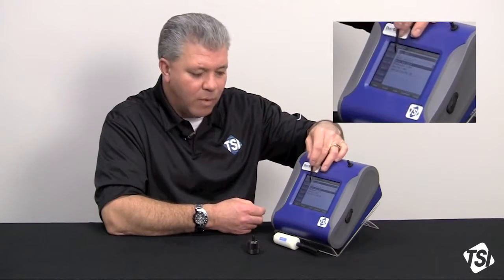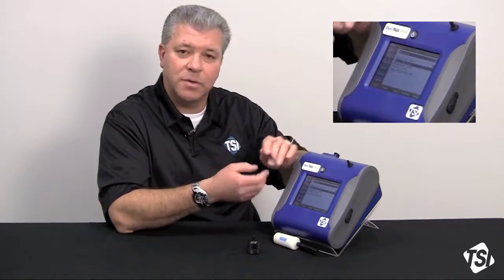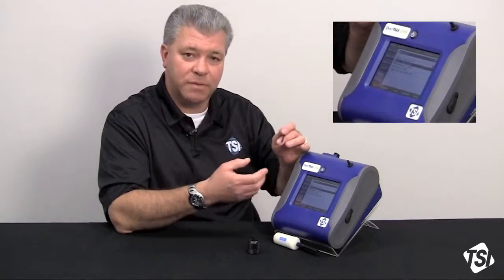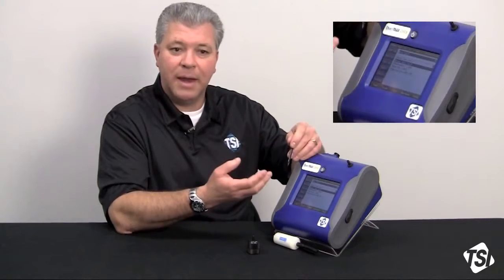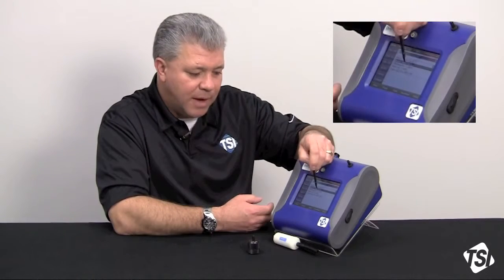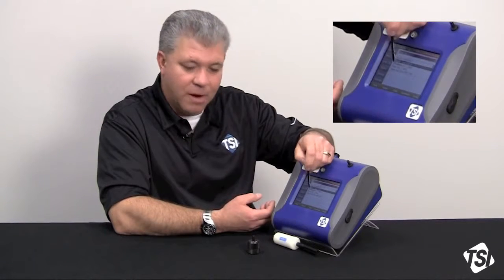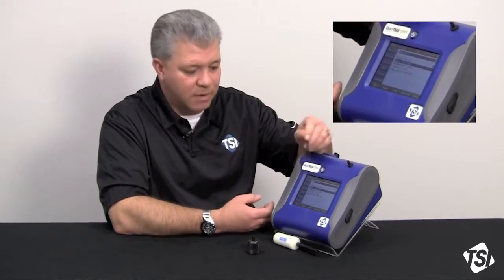I'm going to select one, and when it says Test 1 through 10 you can change the nomenclature to whatever you'd like it to be — a calibration factor for wood dust, for welding fume, for ambient dust, whatever you want. You have a photometric cal factor of 1.0, which is the factory set point for Arizona road dust, and the same thing for size correction factor — it's 1.0.